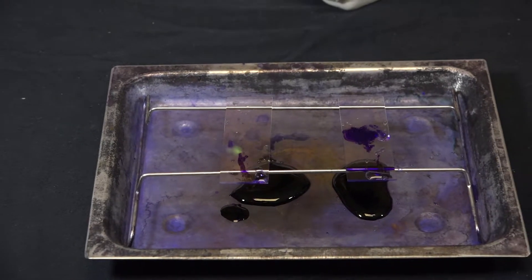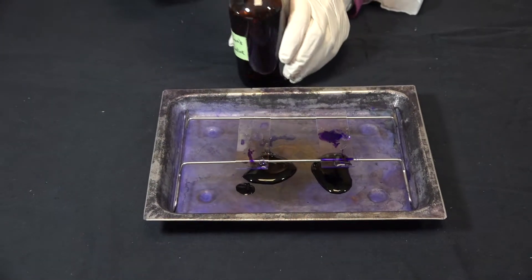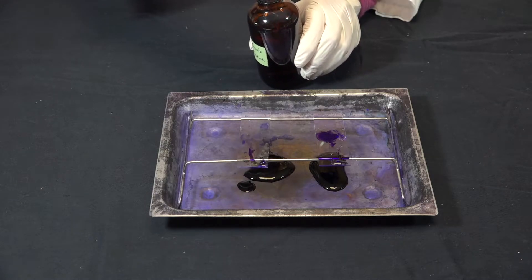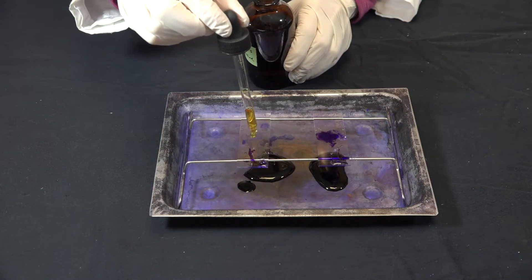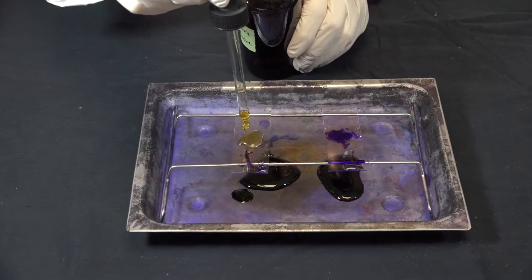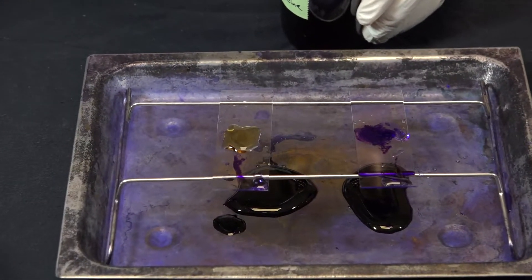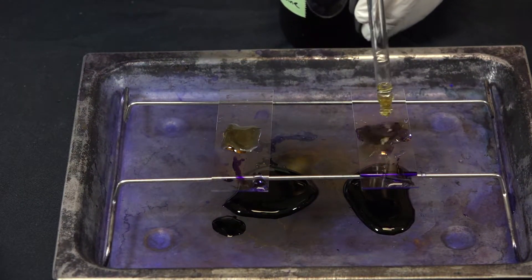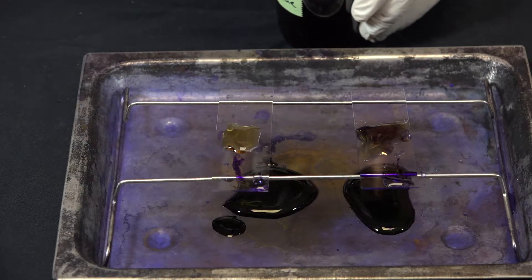Next I'm going to add our mordant iodine. Again, add enough to cover the smear completely. Now we wait 60 seconds.